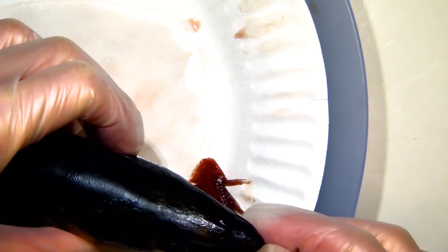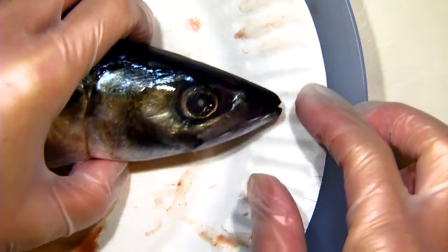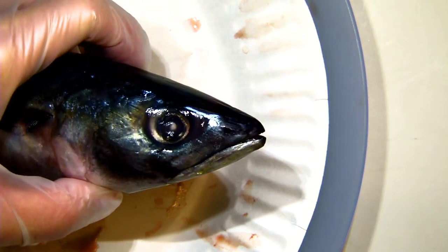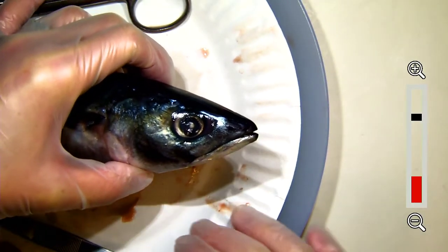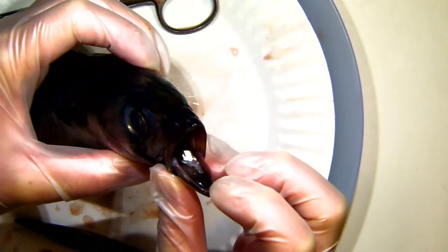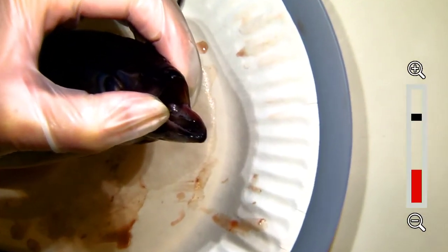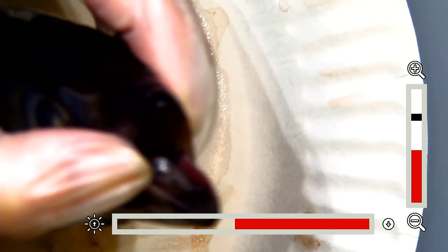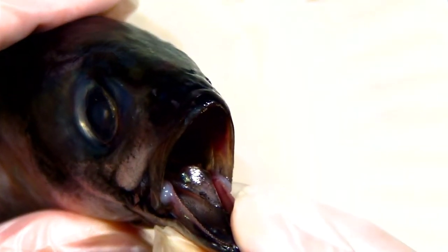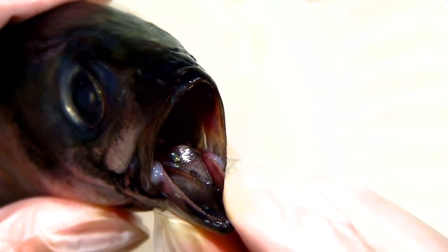But wait — do fish have tongues? Have you ever thought about that? Shall we look? My fishy friend, open wide. It's pretty dark in there — let's zoom in and make it a little bit lighter. Look at that little tongue! It's itty bitty and kind of grayish, but it's there. So yes, they do have a tongue. And I don't know if you noticed this, but they also have a bunch of itty bitty little teeth too — it's a little bit bumpy and my glove does actually get caught on it. So yes, sense of taste confirmed.